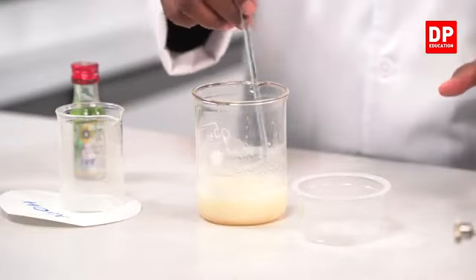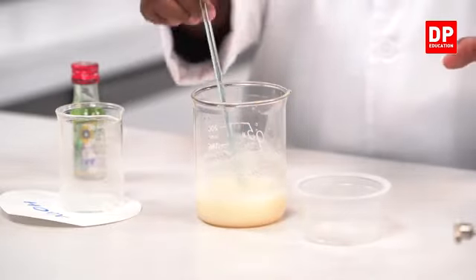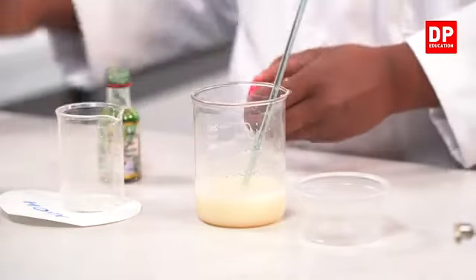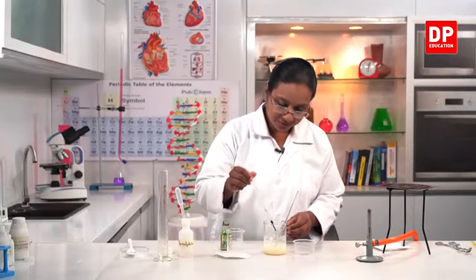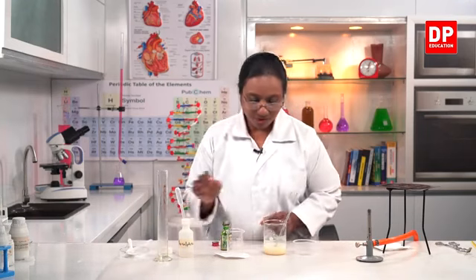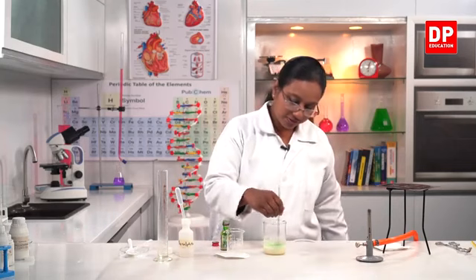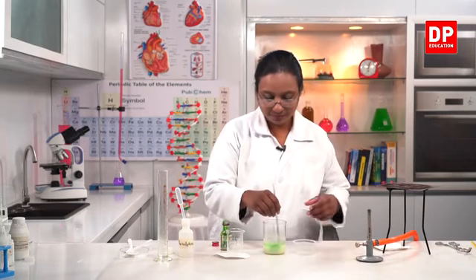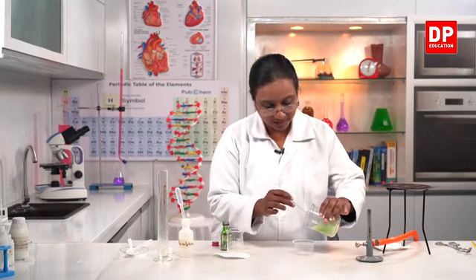Okay students, so now with about 20 minutes of mixing, now you can see the pasty nature of the soap. So to this, I am going to add food coloring to give the color. So this is a few drops of the color, so that you can observe the soap. So now here you can see it's more pasty like, and then I will transfer it into this mold here.